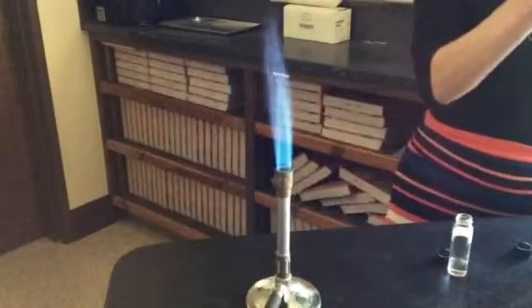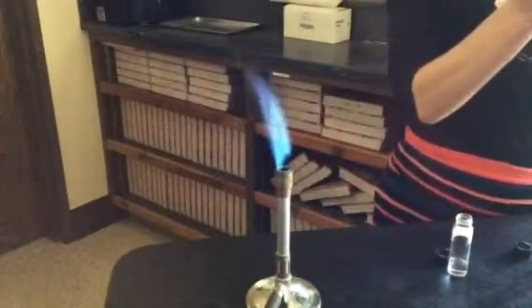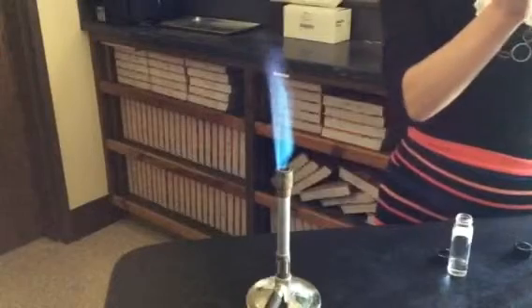So what I am going to do is the flame test lab. This is on page 16 and 17 of your lab book, so turn to that page in your green lab book and you're going to fill in some data. You'll see a table on page 17, I believe, with different elements listed. So I have these elements dissolved in water.